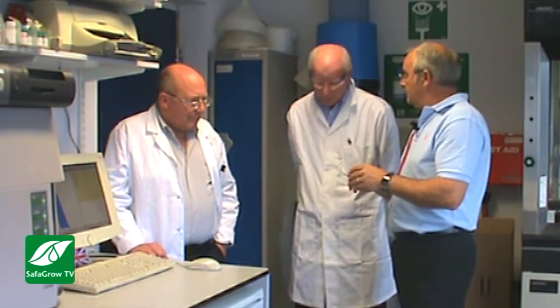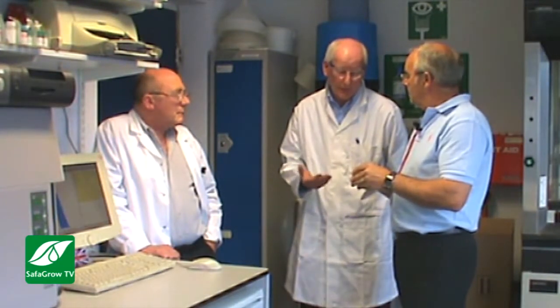So that's fairly small, 2 micron. How long do they have to stay in that mill to get them down to that size? The flow rate depends on individual products, because we have different specifications and the hardness of the raw materials. But without the calculations, the throughput is somewhere around 800 kilos an hour. That seems a high output to me. Quite a high output. They're quite big bead mills, about as big as you'll get.